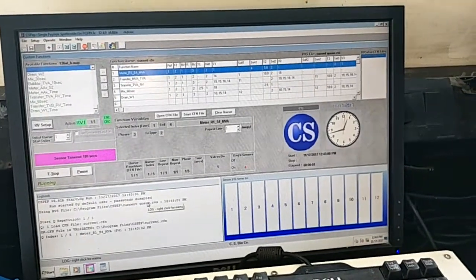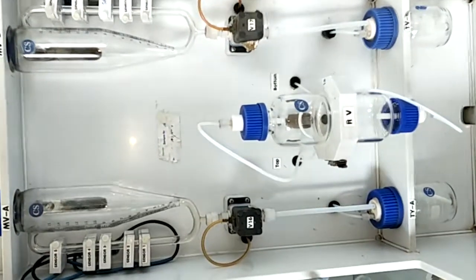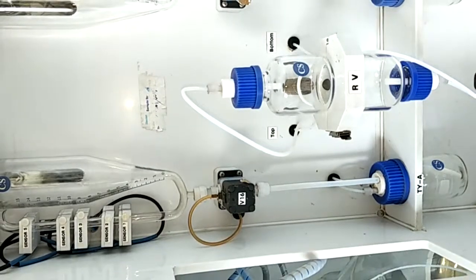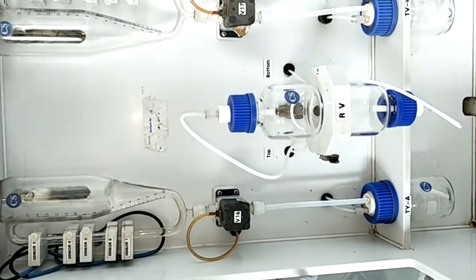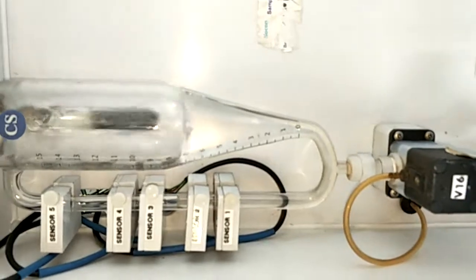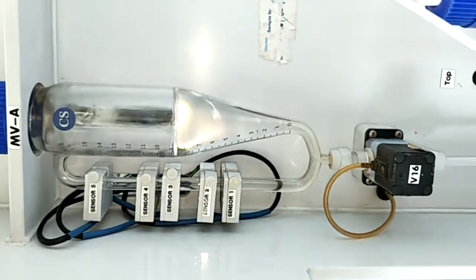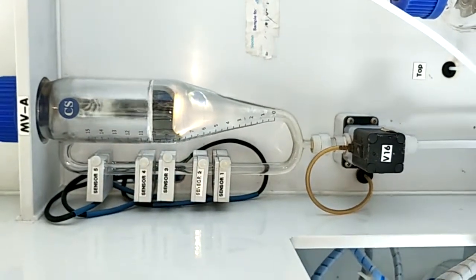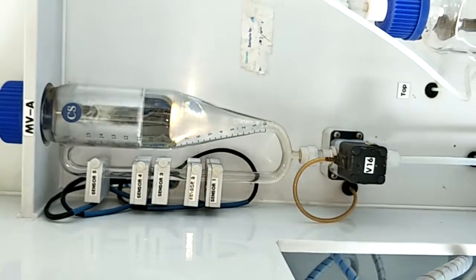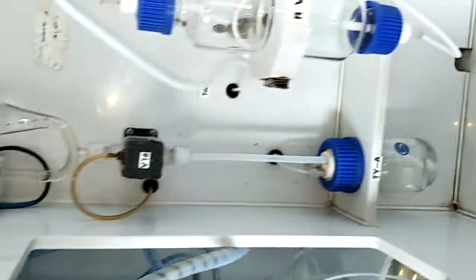This is the second time we are trying to do this for MVA once again. It has come up to sensor 4. Now it is being transferred to TVA.